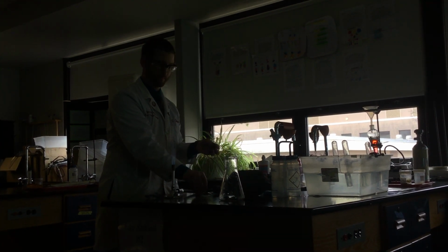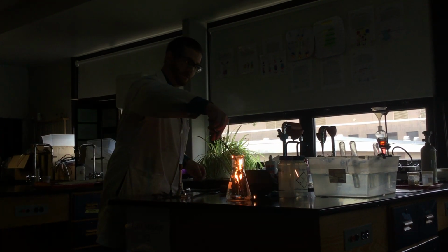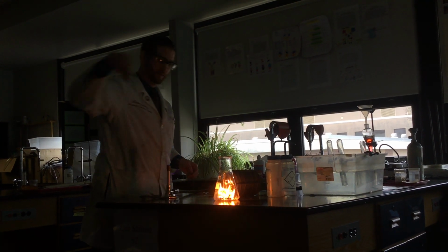Not so much. Maybe that piece was too fully reacted there. Get it reacting, get it reacting. Oh, there we go. Definitely a much faster reaction. Any questions on that?